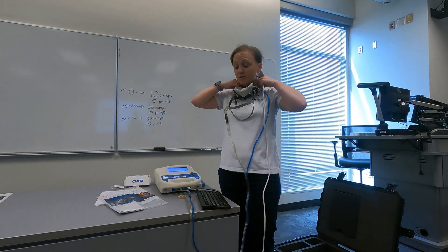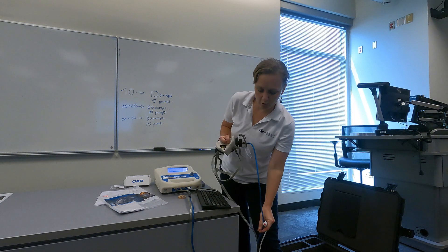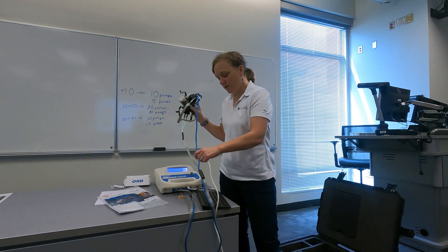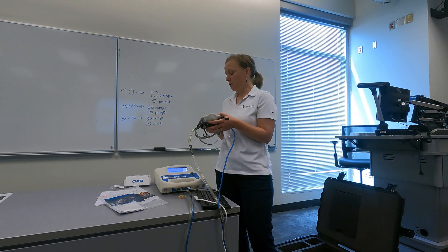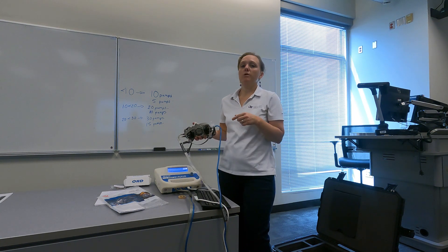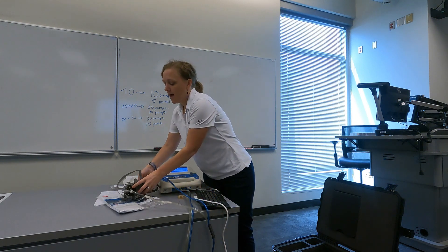A couple of things to be aware of when doing a quantifit: not everybody can get a successful fit with quantitative fit testing. Some people struggle if they have a perforated eardrum, serious nasal issues, or trouble holding their breath for an extended period of time. In that case, you may want to opt for earplugs during the test or try one of the qualitative methods. The PortaCount method has some similar ups and downs. Thank you.